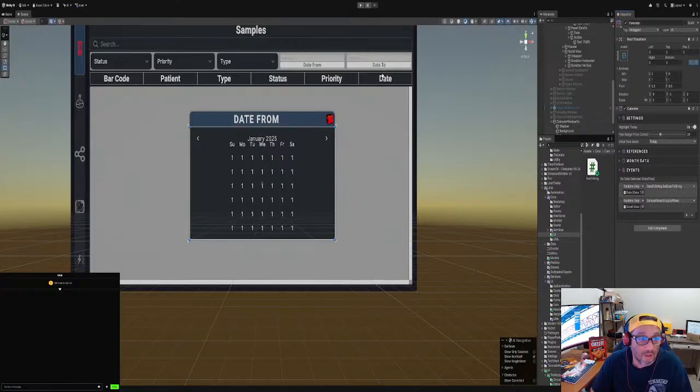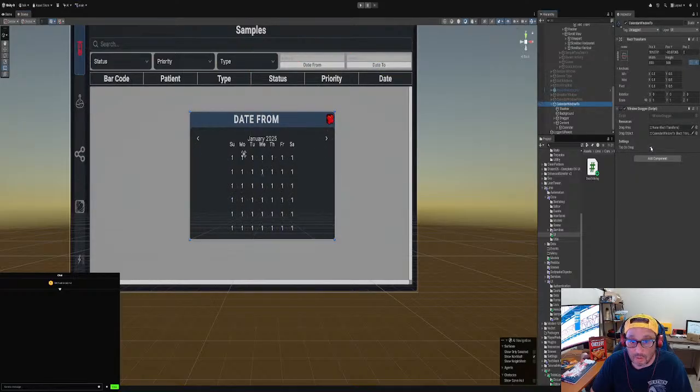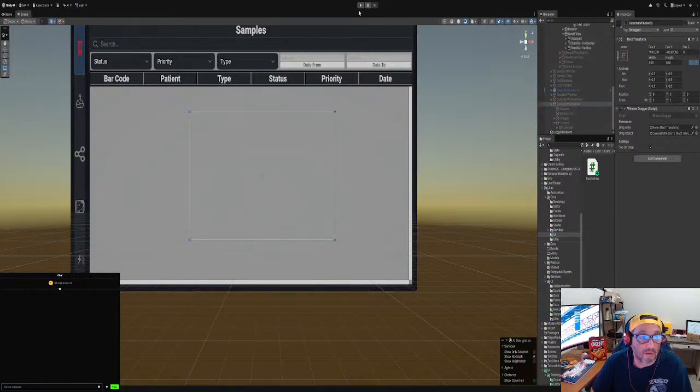And then on this button here, we need to set it so we open this thing here whenever we want to. So, button, reference, calendar 2, game object, open. You make sure this is clicked, all right? Then we close all this out, and then we'll try it again one more time. And that should work. If it doesn't work, we have to figure out the code, what's going on.